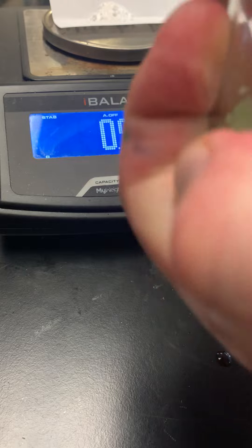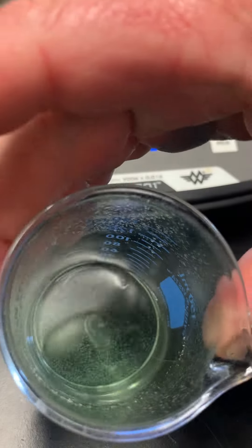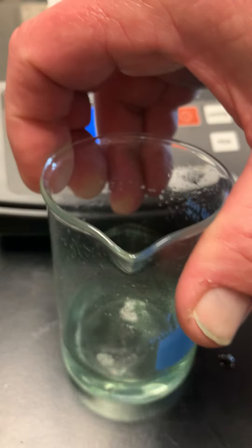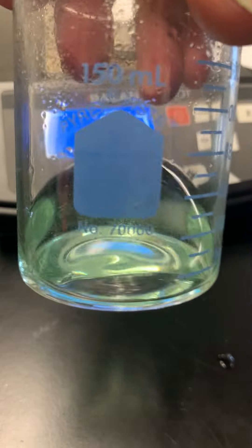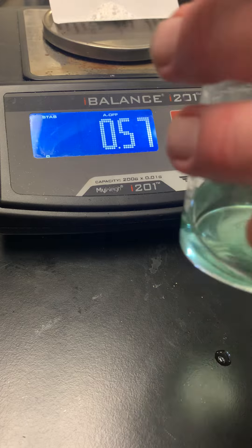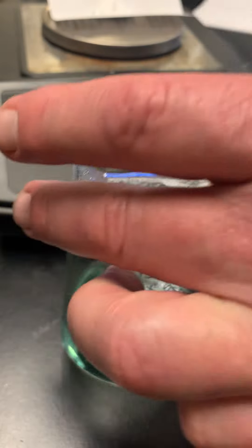I'll try warming it up so the reaction goes faster — a warmer cup speeds things up. You can see almost everything has dissolved and there are very few bubbles being made, so the reaction is nearly done. We want the color to go green, and it would eventually turn blue. You can already see it's getting more blue than green.